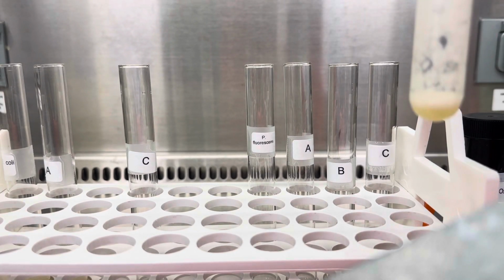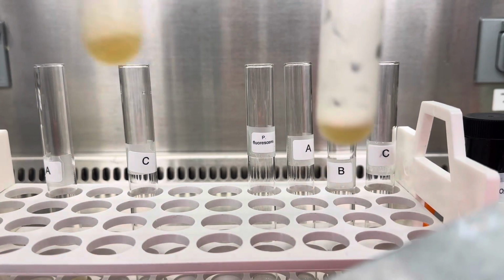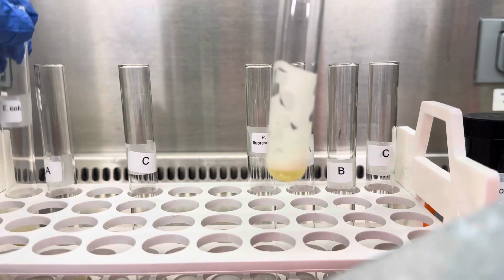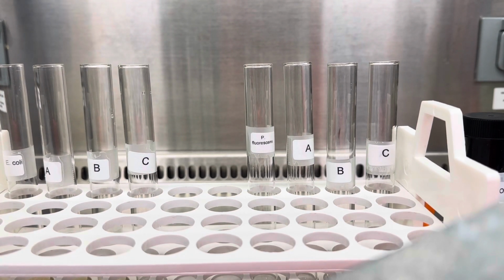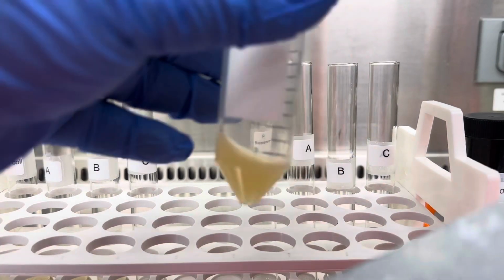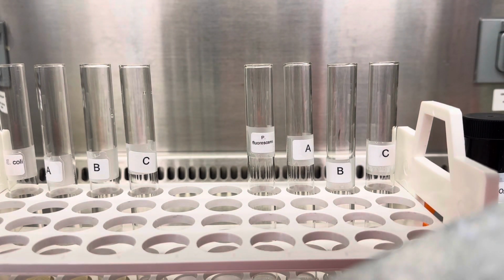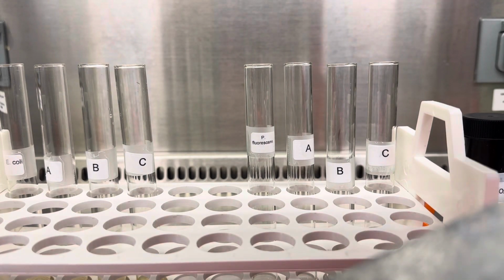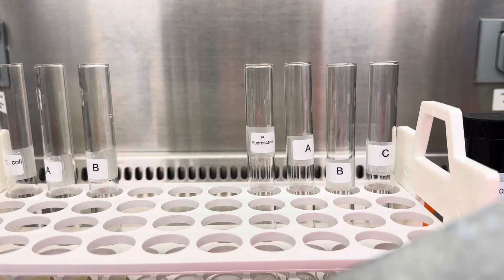It's very obvious as well that this second colony that I isolated is also catalase positive, and you can actually see how it compares to the positive control, okay? Now let's do unknown C, and in between, guys, I'm changing tips so we have no cross-contamination. You always use a new tip between different cultures, and that's my unknown C. Then I'm gonna add some of that to my last tube over here, vortex it, and let's see what's going on.